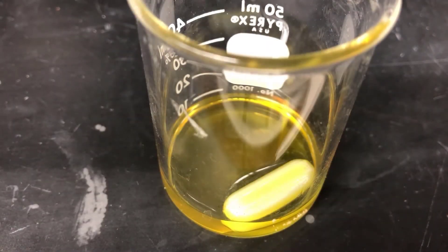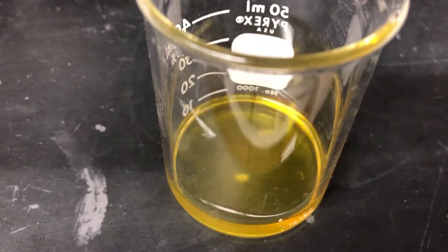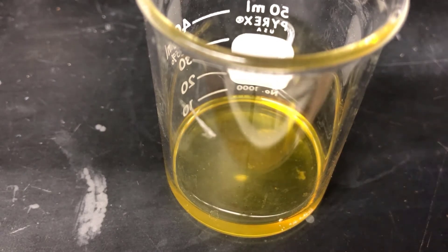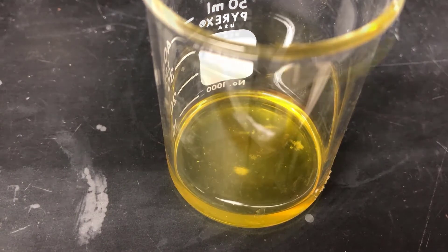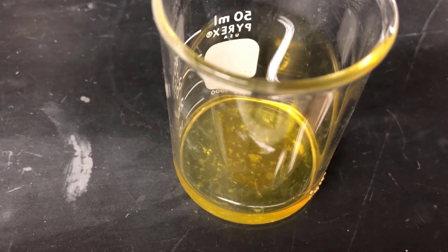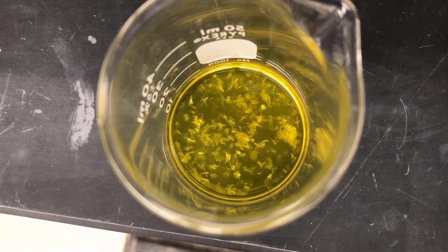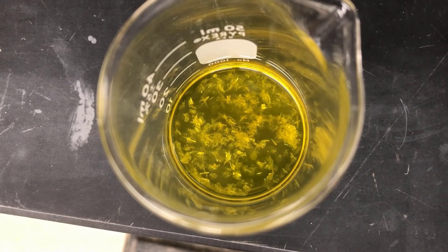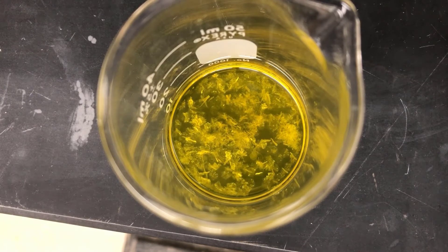I'm going to pluck the stir bar out now with a magnetic stir bar retriever, which is just a magnet embedded in a plastic stick. As the solution cools, we'll start to see crystals. You can see a few sparkly flakes forming here, which will spread and grow. I'll give you another view from a different angle so you can see them a little better. From an overhead view, you can see the crystals have grown and expanded. When one crystal forms, it acts as a seed for other crystals to form, and the process continues on its own.